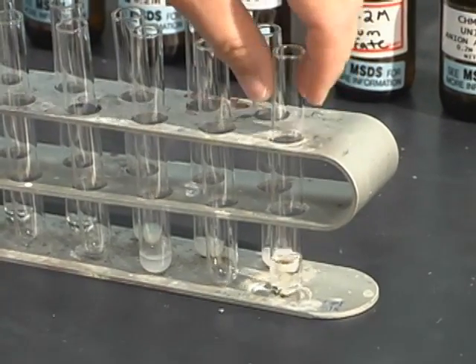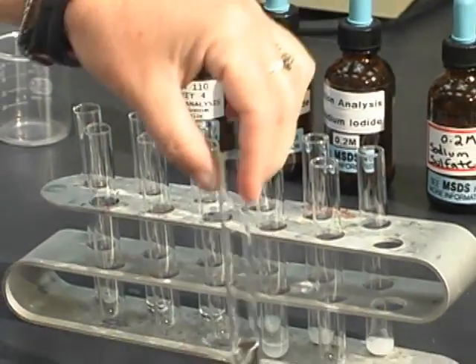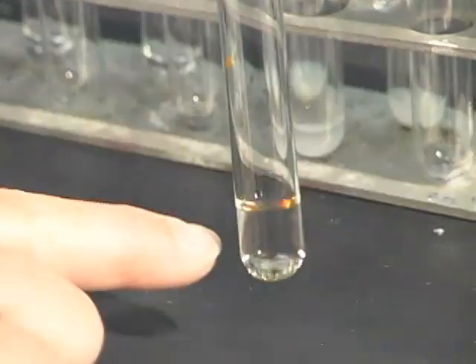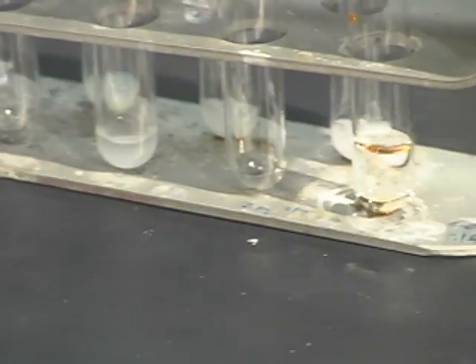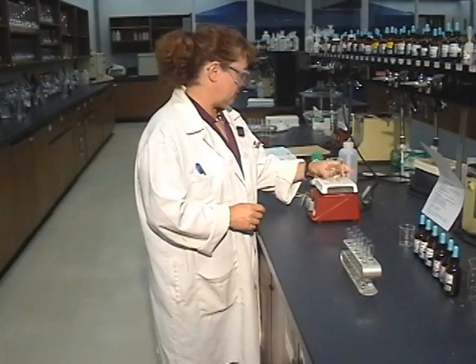Now it's in the bottom, it's dissolving, and you can sort of see there's colour in the bottom and it goes clear at the top. Now we need to heat this solution, and that's going to take a little bit of time.